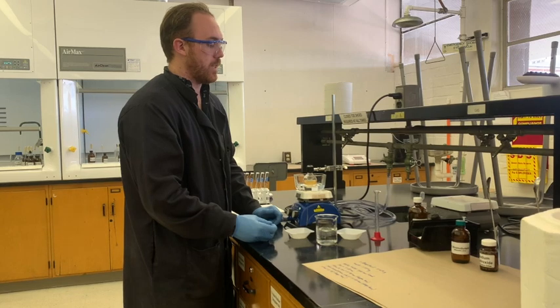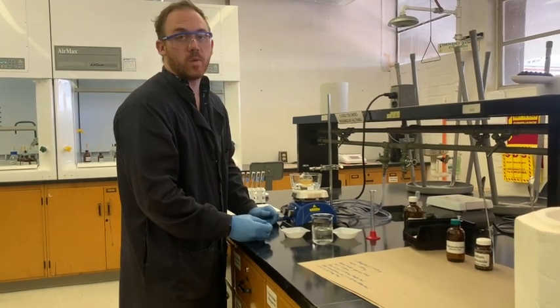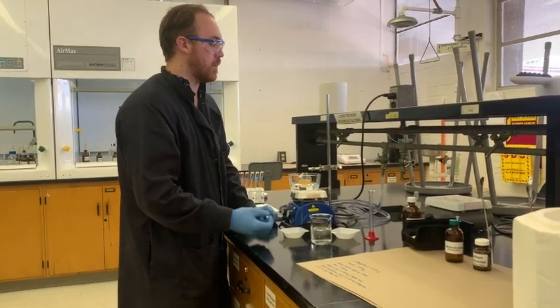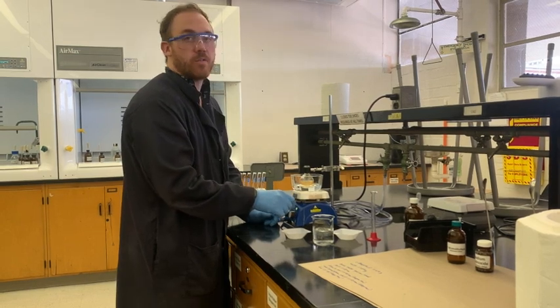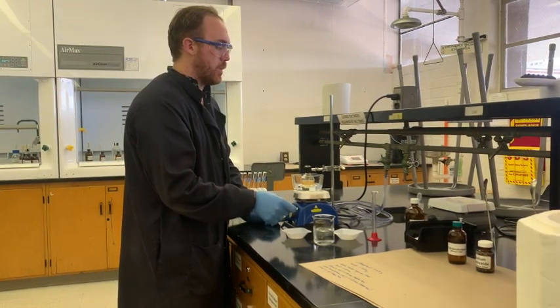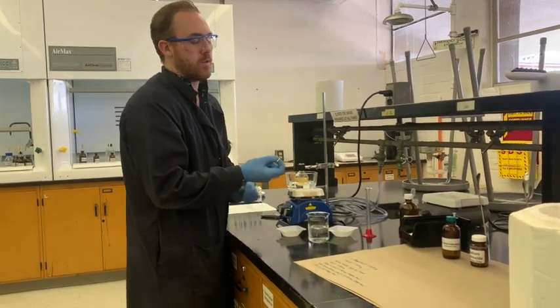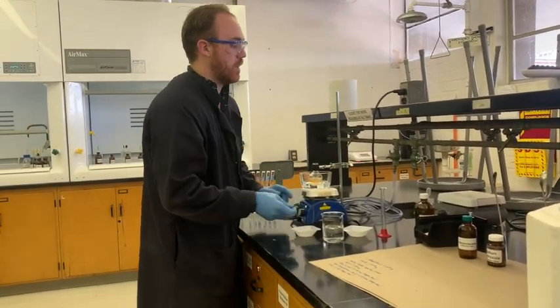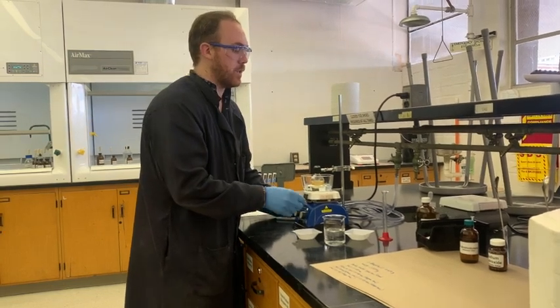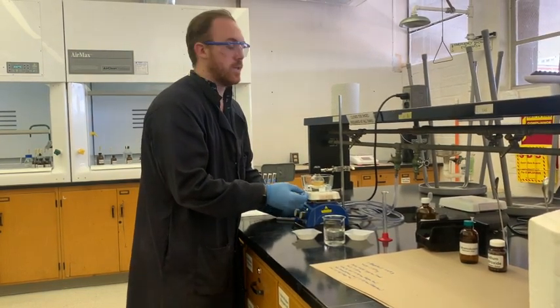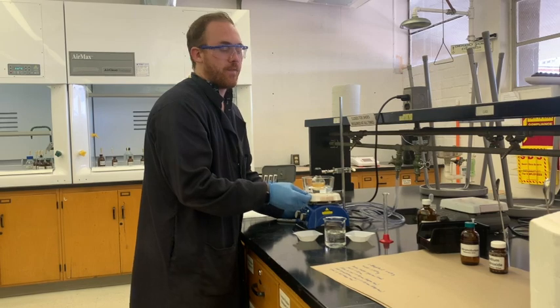So what I'm going to do is also I'm going to start adding little chips of ice to this reaction. That's going to do a couple things. It's going to cool down the reaction faster, and it's going to change the solubility of the reaction. So if the product is not going to be soluble in water as the ice melts, it's going to start to fall out and that's going to help you start to precipitate your reaction. You want to make sure that you don't put so much ice in there that you're going to have chunks of ice clogging up your filter or mixing with the product. You want to just add enough ice to get by.